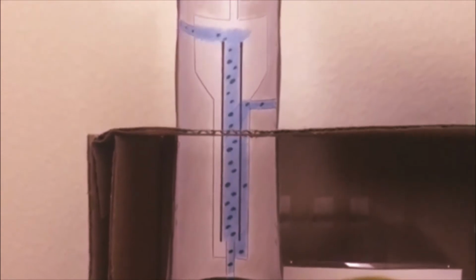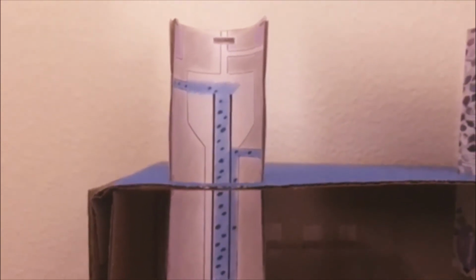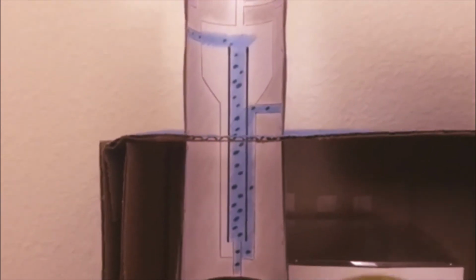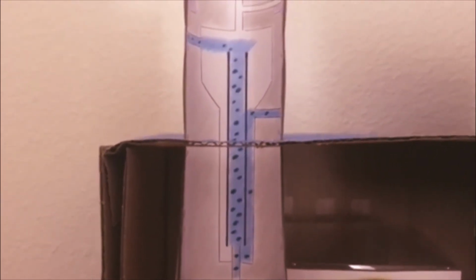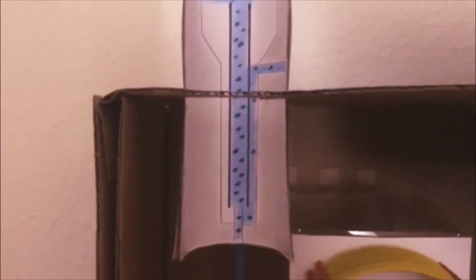This is done by having a split point that shuttles most of the sample away from the column. There is also something known as the split ratio, which is basically the amount of sample that does not reach the column versus the sample that does reach the column.